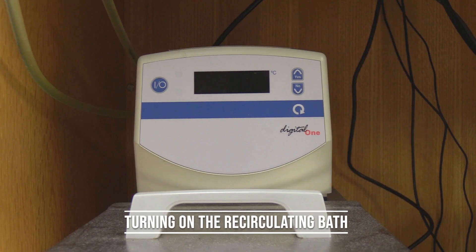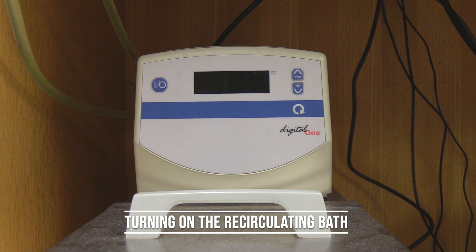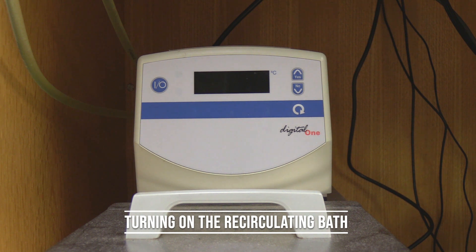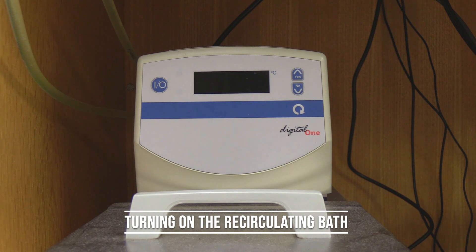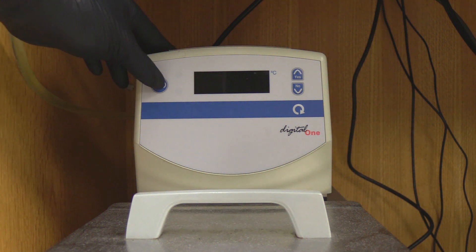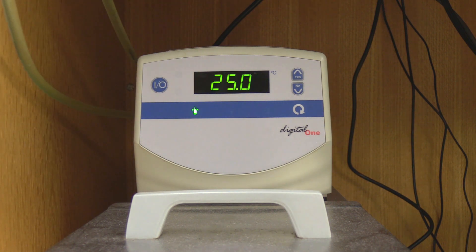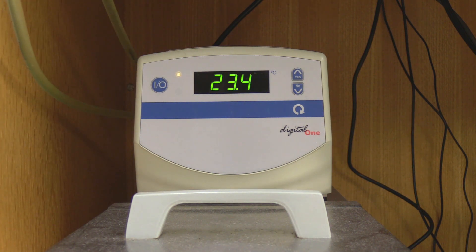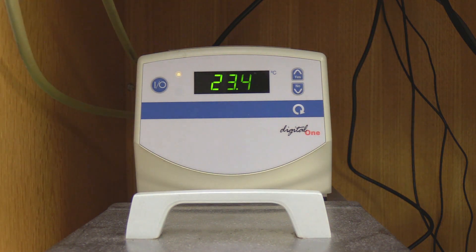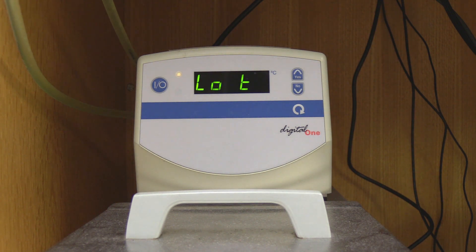Turning on the recirculating bath. If temperature control is needed, the operator will need to turn on the recirculating bath. Press the power button on the top left corner of the recirculating bath. The recirculating bath should already be set to 25 degrees Celsius.